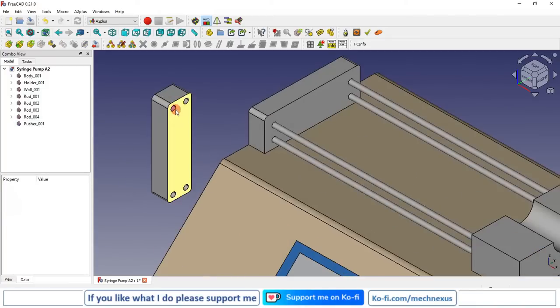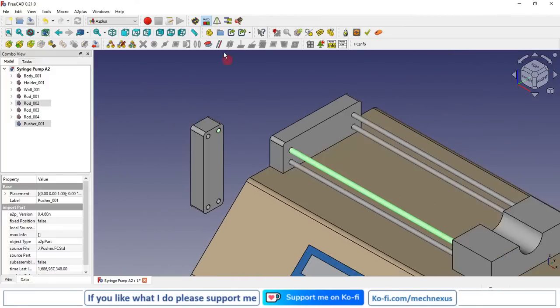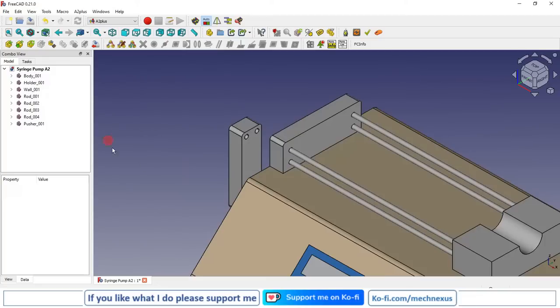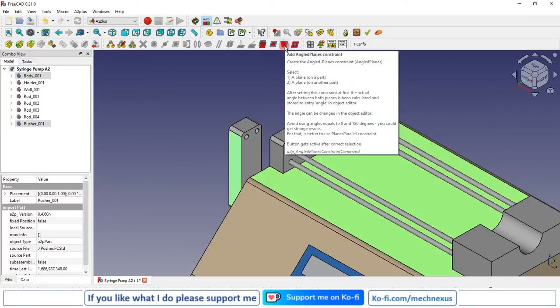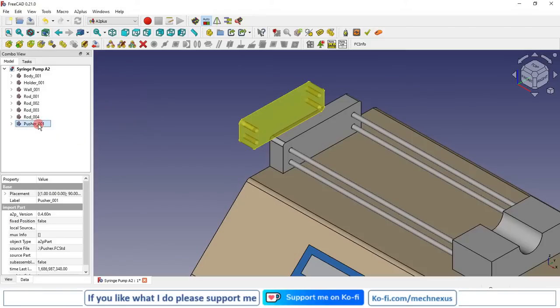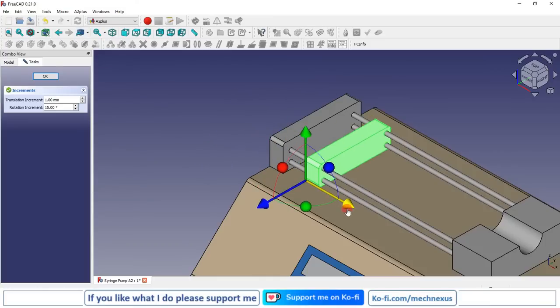Now I will select this hole surface and this rod surface and give the axial constraint, apply. And I will select this and this surface, and I will select angle plane, and from here I will give 0 degree and I will accept it. Now I will click on my pusher and click on the transform and I will move it.